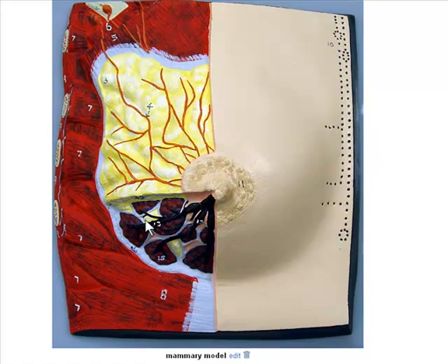The actual lactiferous glands that we see here look kind of alveolar in structure. Then we have the mammary ducts that you see going through here, numbered 13 right there. These lead to the lactiferous sinuses, the enlarged areas that we see through here. Those lead to the lactiferous ducts that then come together in the nipple, surrounded by the areola.